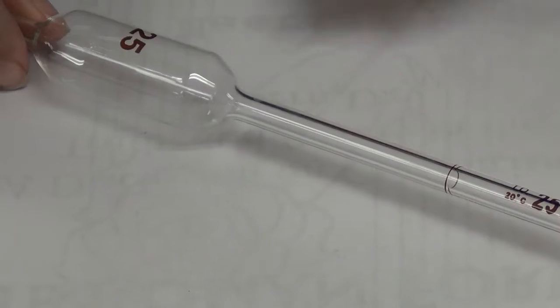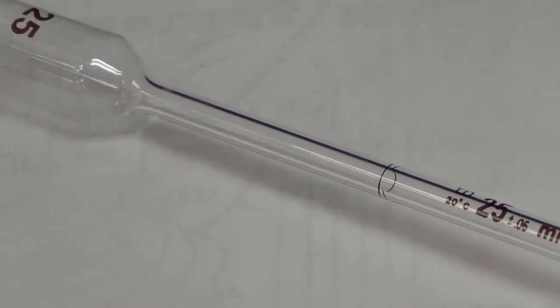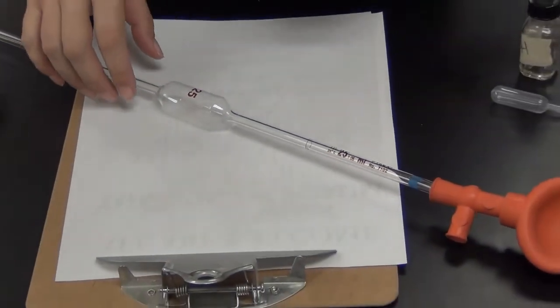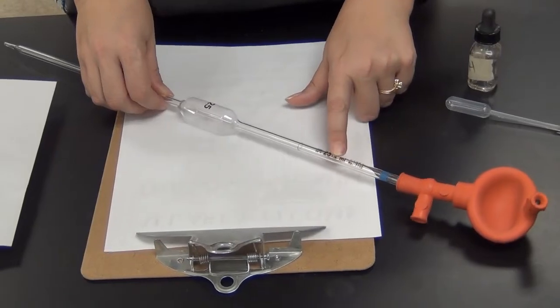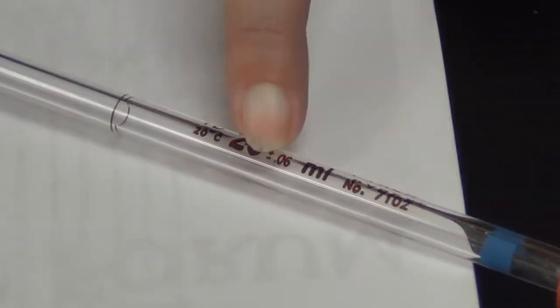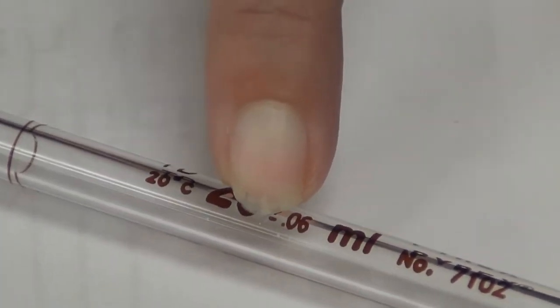Well, why would I want to spend the money to have a pipette that measures exactly one thing? Why wouldn't I want something that's graduated like my burette is? That's because this is extremely accurate. It is down to hundredths of a milliliter accuracy. So it has one job, but it does the one job very well.